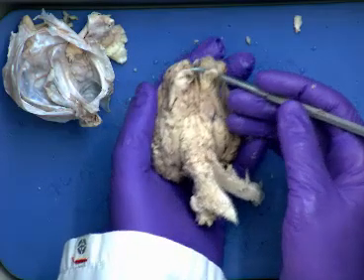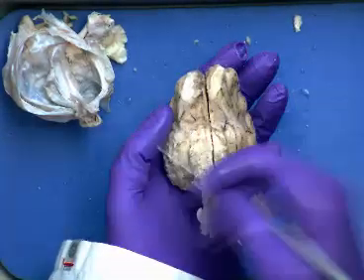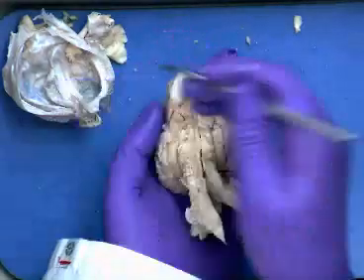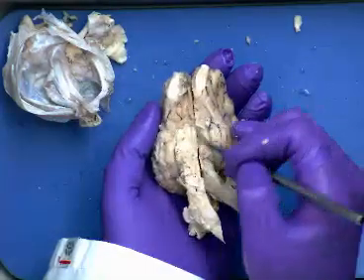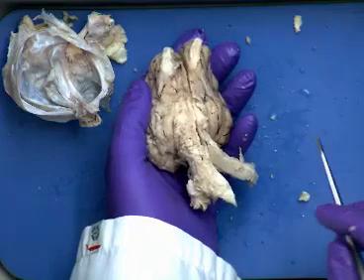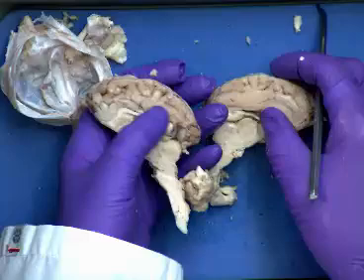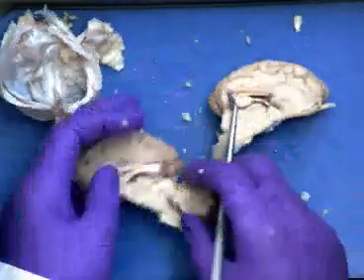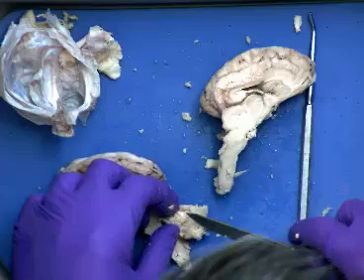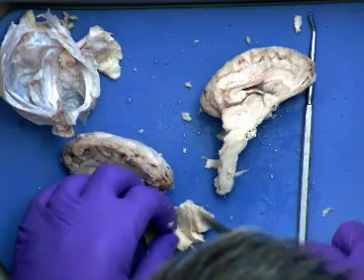Then optic chiasma. The optic chiasma was kind of hard to see in my particular one because of the way that the dissection was coming off in there, but it was going to be this X-form structure underneath there. So we can't quite see it on my example. We did thalamus, hypothalamus, corpus callosum we saw. And then the pattern of white matter inside of the cerebellum, you'd have to cut into it in order to be able to see it.